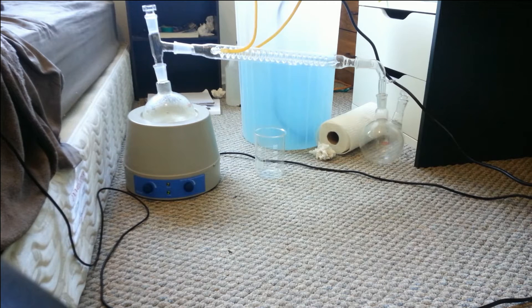Once it does actually start boiling, you'll see the steam go through the condenser and start dripping into the round bottom flask on the right.